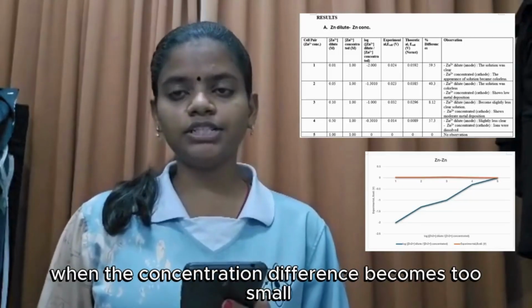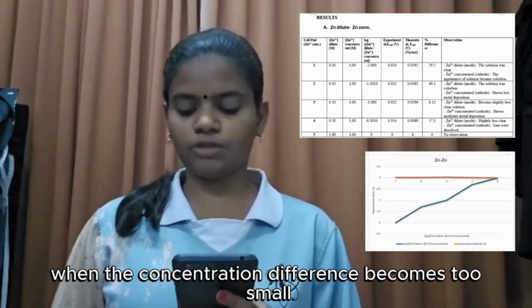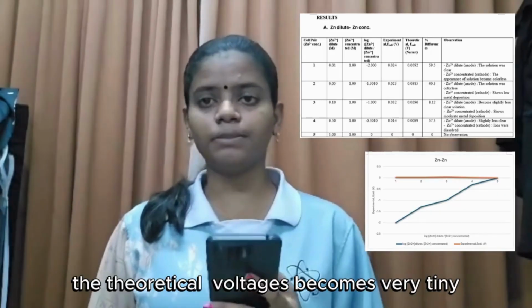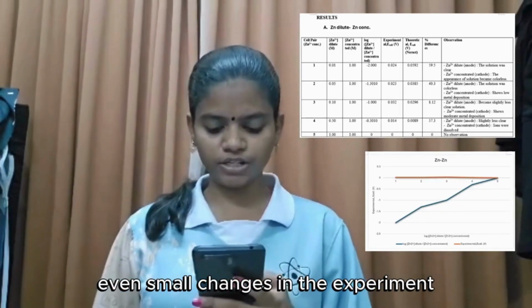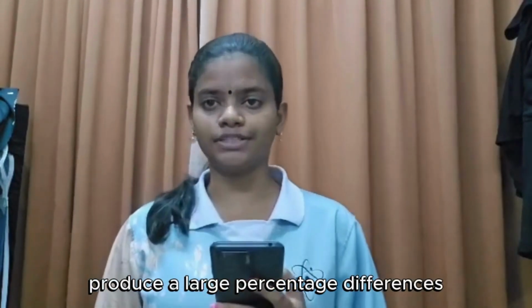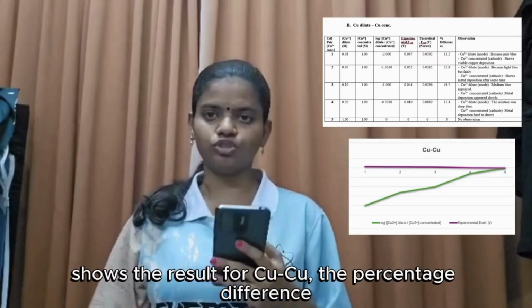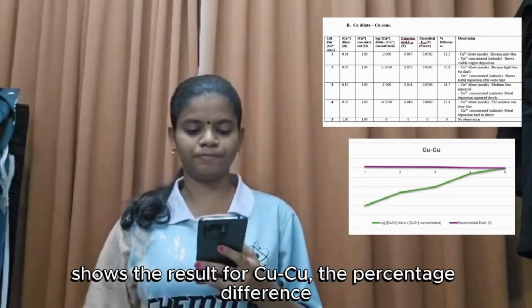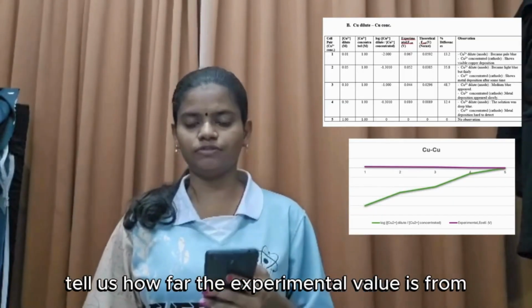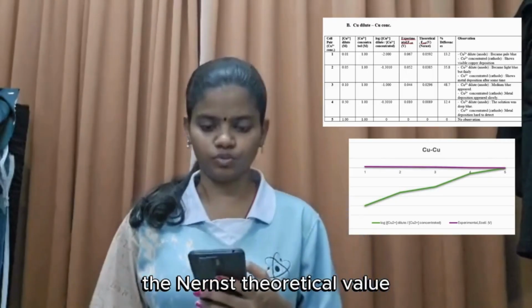When the concentration difference becomes too small, like 0.5 molar versus 1 molar, the theoretical voltage becomes very tiny. Even small changes in the experiment produce a large percentage difference. So, table 2 shows the result for copper. The percentage difference tells us how far the experimental value is from the Nernst theoretical value.